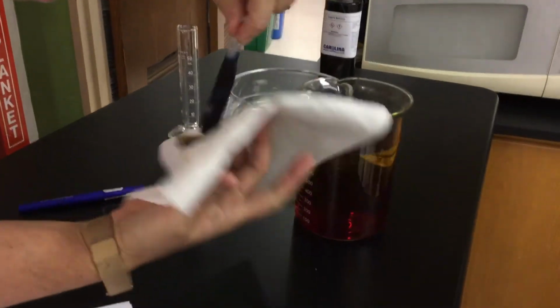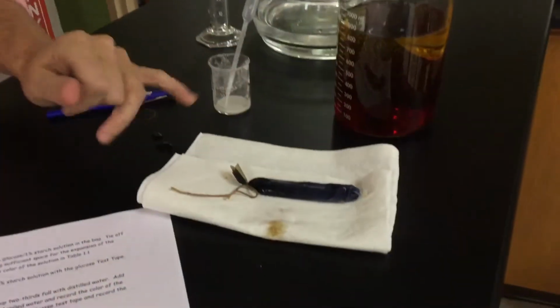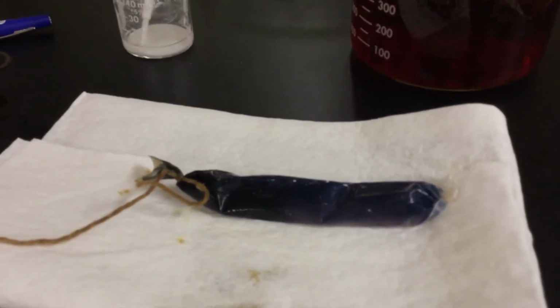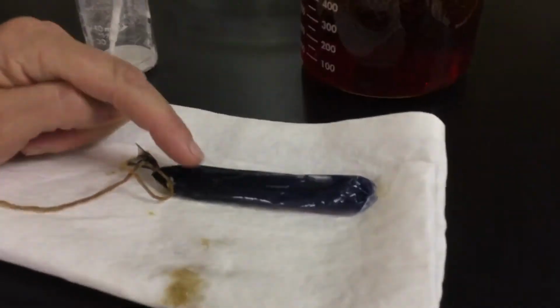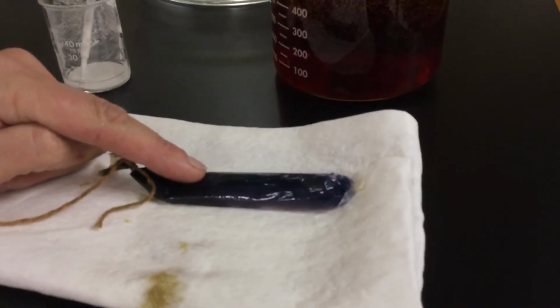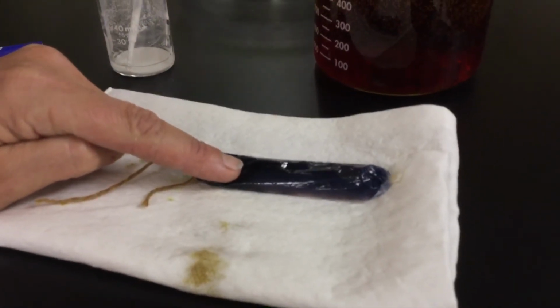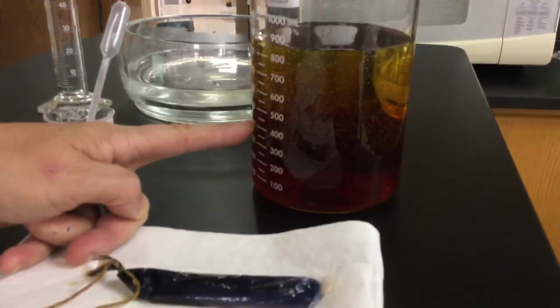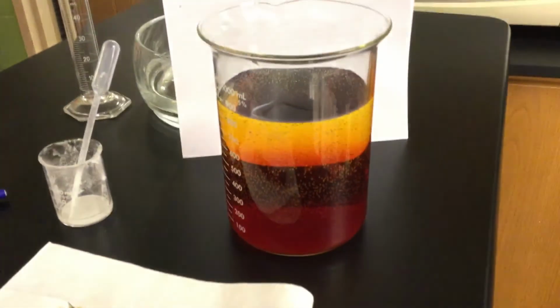Now what we have, I'm going to blot this off just so you guys can see. That's my baggie now. It's kind of this gross purple black color. So what does that mean? Well, we just said iodine is a starch indicator, and when iodine and starch come in contact, that iodine turns basically a dark black or purple. So I can say that iodine is moving into the bag. So you think, well, does cornstarch move out of the bag? Well, the answer is going to be no, and the reason I know that is that the solution is still kind of an amber black color. It's not a purple color, it's still the same color we started out with.